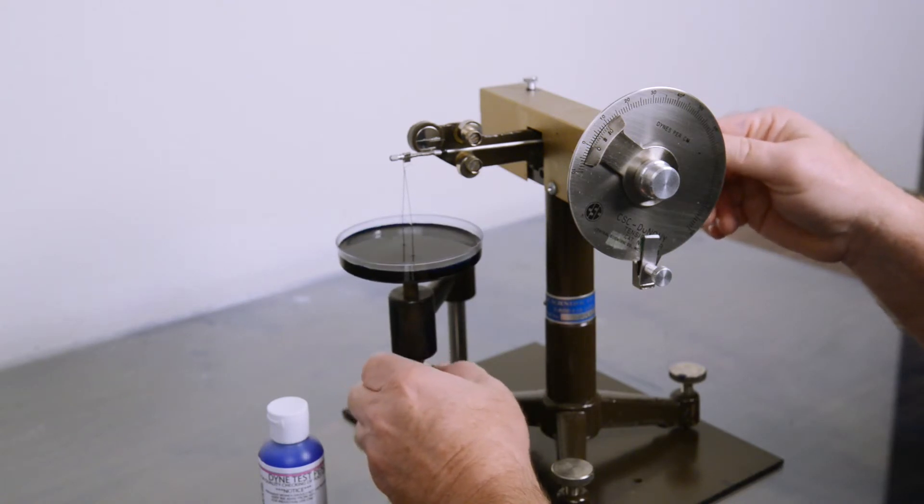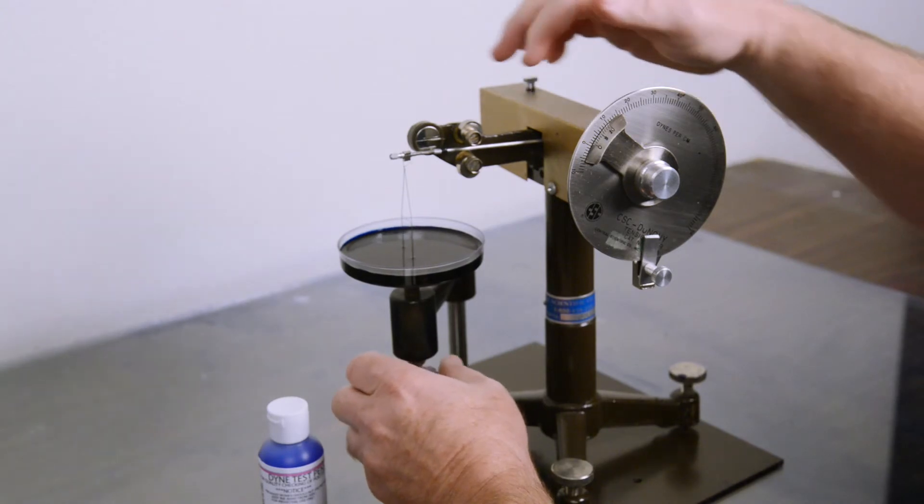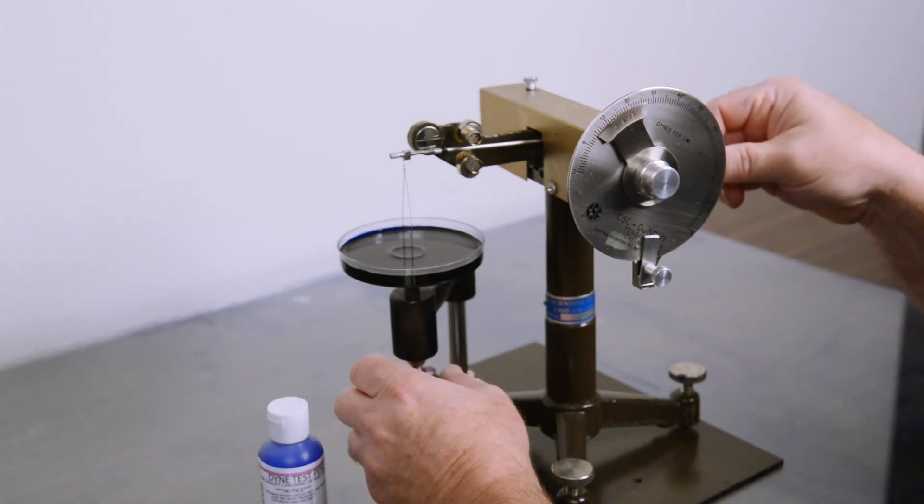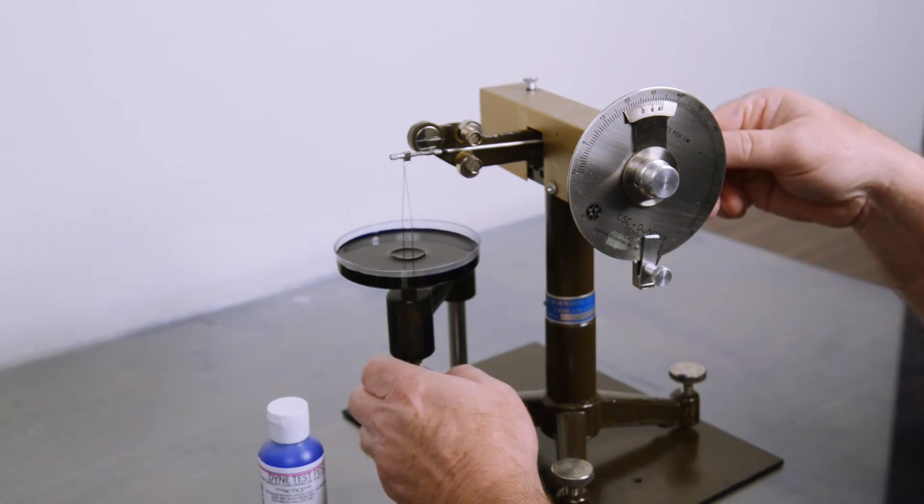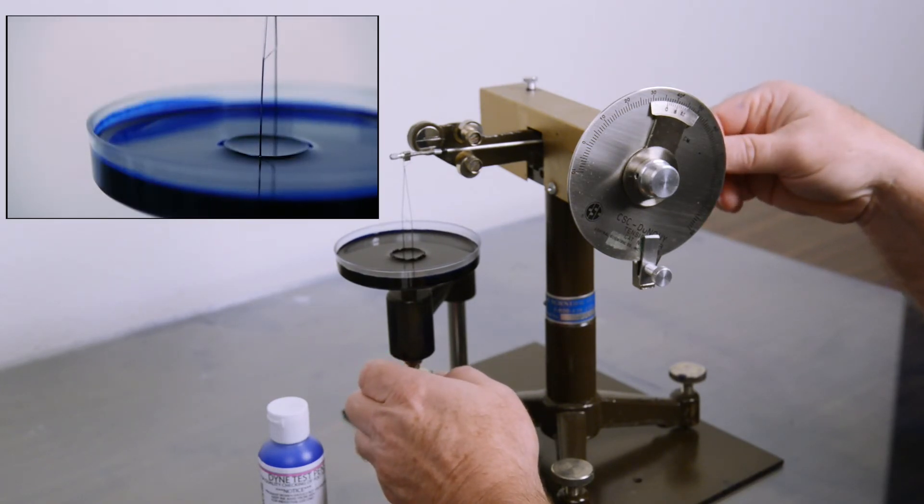Then we are going to lower the arm so that there is some tautness on the dish showing where the line is still lined up and we can start turning the dial for the tension. While still lowering the arm, raising the tension, lowering, raising, lowering, raising.